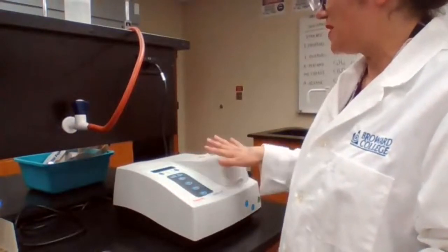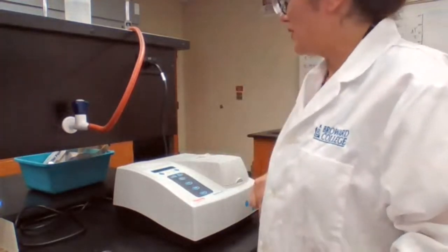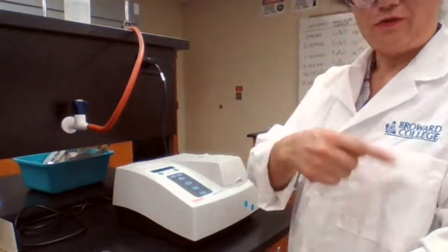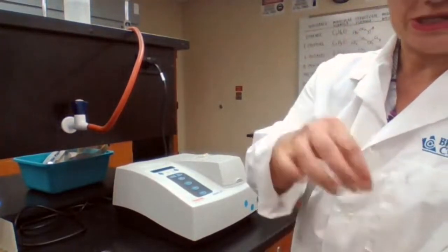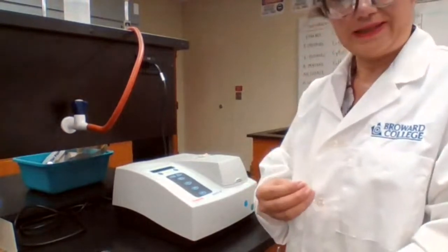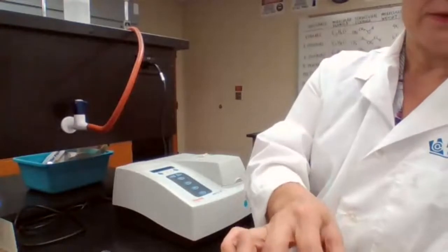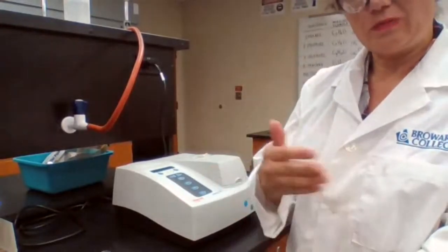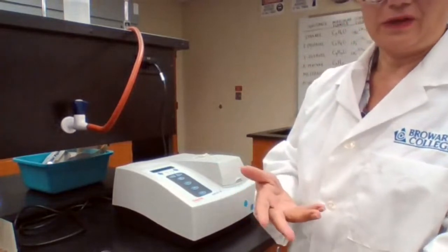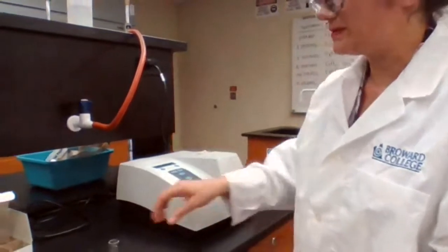Pressing 100% to calibrate the machine with solution A. Because solution A has no iron, the machine reads it as 100% transmittance — this calibrates the machine so that for other samples it will read the change in color. The more color generated, the higher the absorption of light, and therefore the smaller the value for percent transmittance.